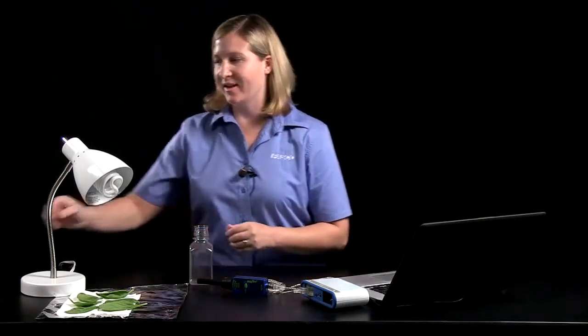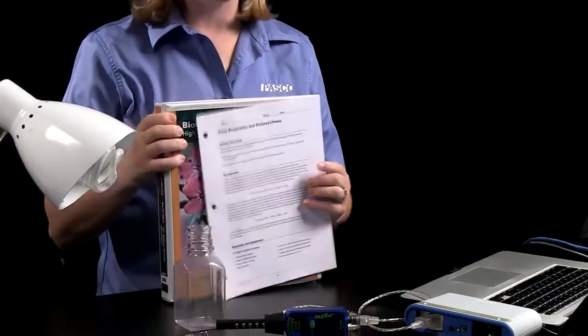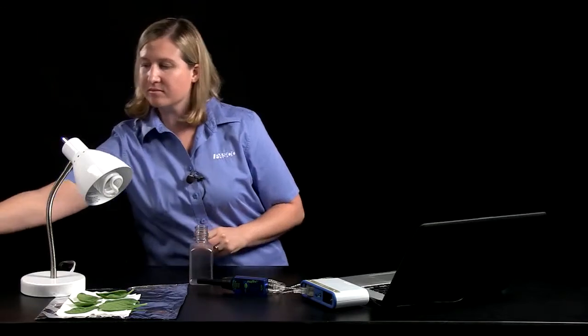And today I'd like to share with you our plant respiration and photosynthesis lab. It's a paper lab that is part of our latest edition of the Biology Through Inquiry Manual. And you can find details at the end of this video for how you can get it as a free download on our PASCO website.